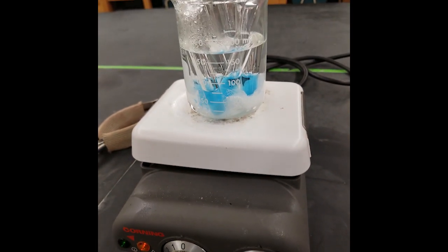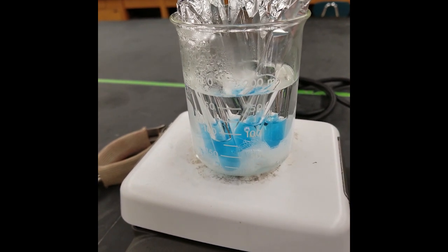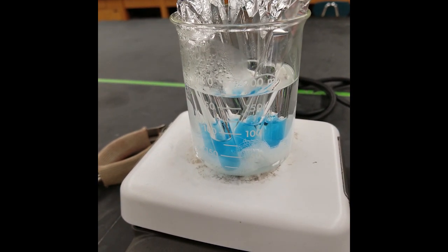If the water is too hot and boils more aggressively, the cheesecloth at the bottom will bounce around and disrupt the tubes, which is actually not good for your experiment because the copper reagent can unnecessarily react with the air and end up skewing your results.